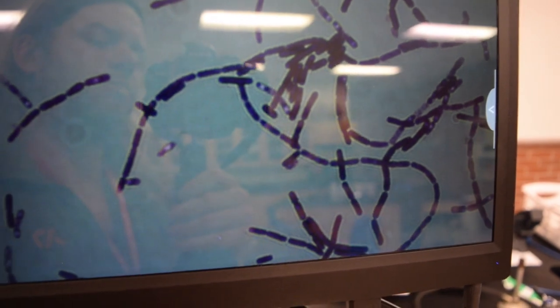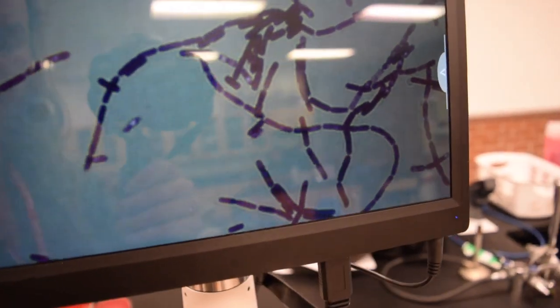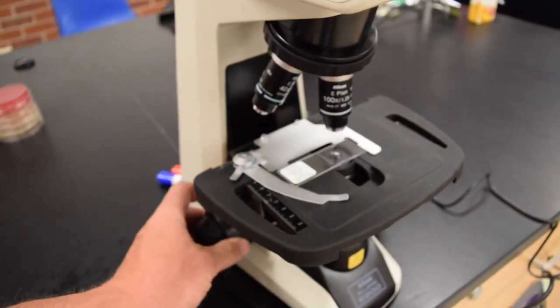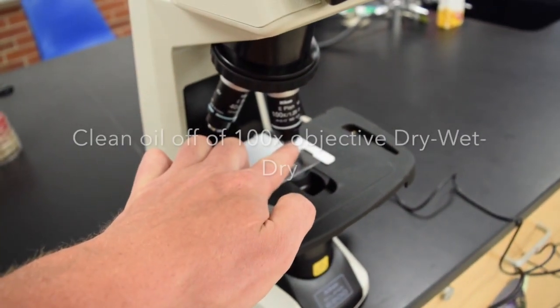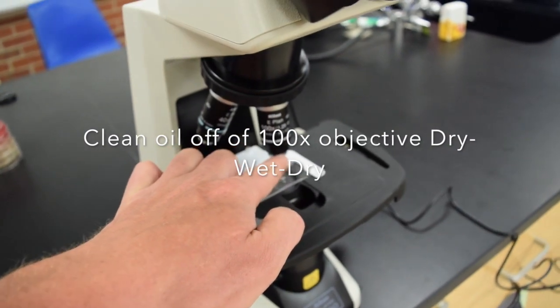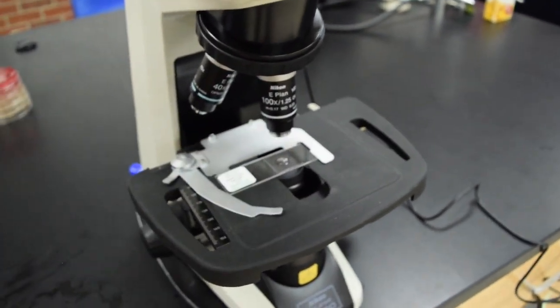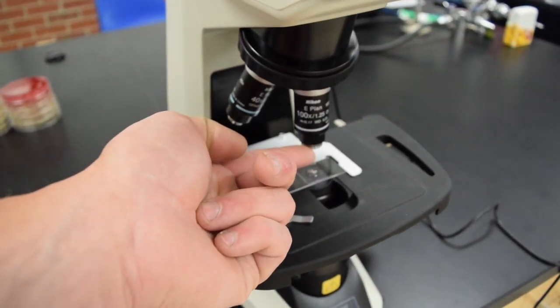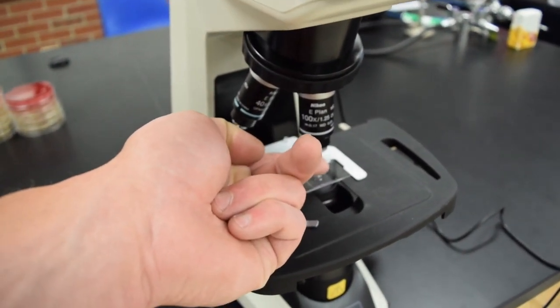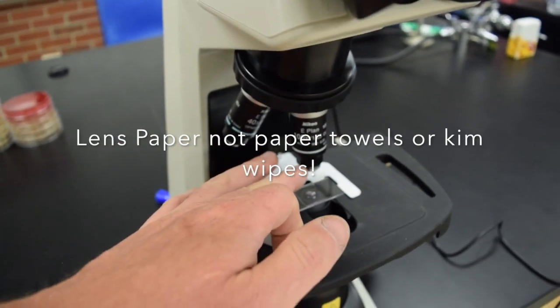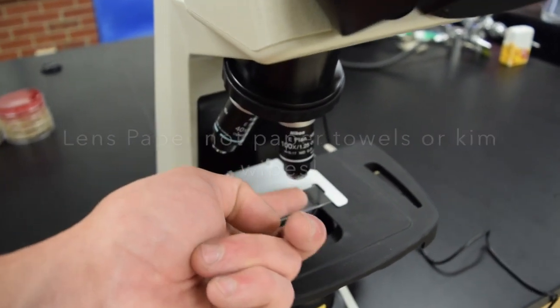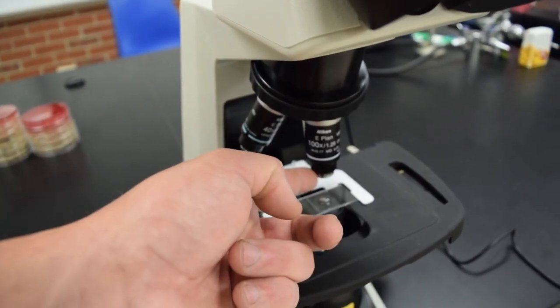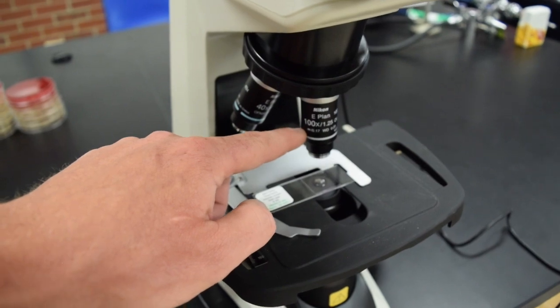When we store these microscopes or when switching slides, move the stage all the way down. You would clean the oil off this lens with Sparkle cleaner, which is in one of your drawers under your station. Use dry lens paper to get most of the oil off, then use Sparkle cleaner on new lens paper, then another dry paper - so dry, wet, dry to clean the oil. This is the only lens we have to clean.